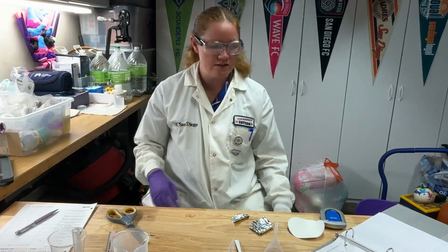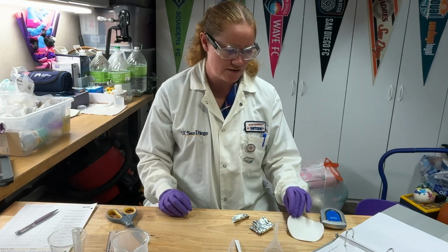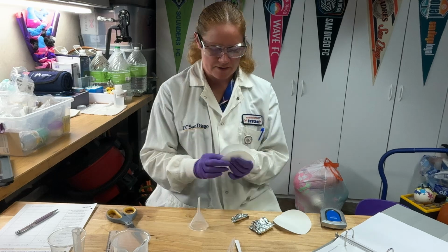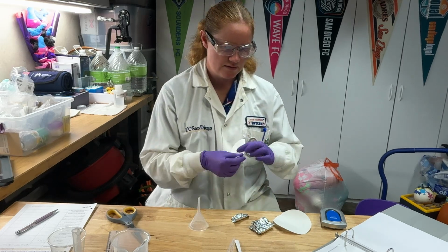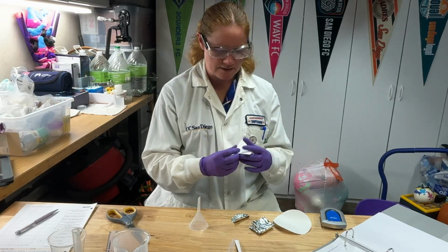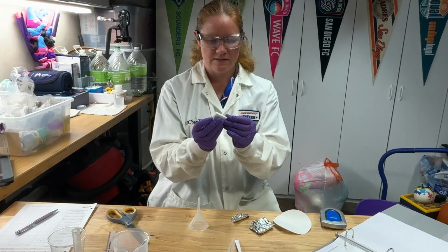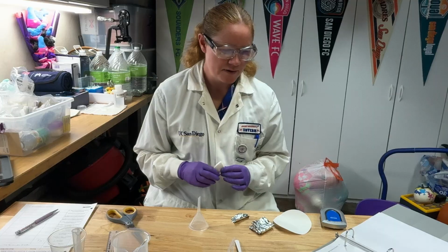Now, what you'll want to do is once your reaction is finished, you're going to want to go ahead and get your filter paper and your funnel set up, okay? So you can fold your filter paper, okay? All right, I like to fold mine in half and then in half again, and then I fold my sides up like this. So it looks like this, and I find that helps me put it in the funnel, okay?